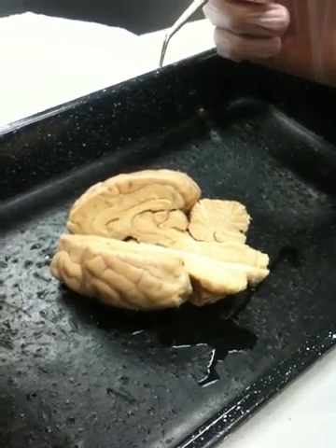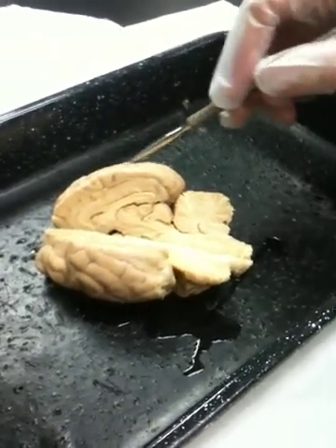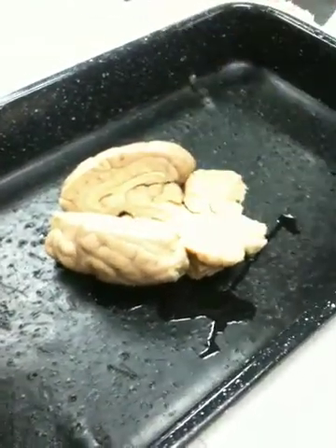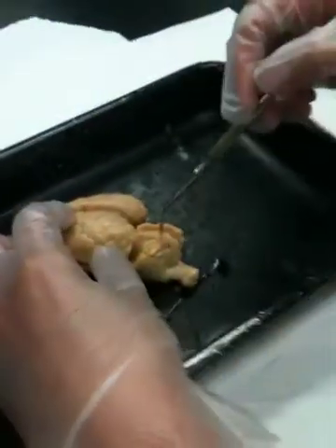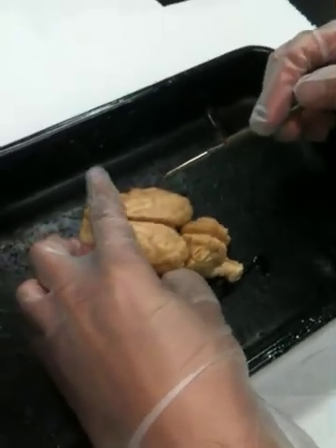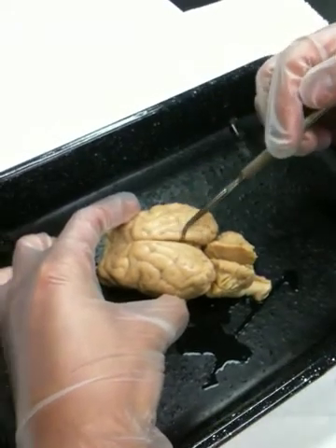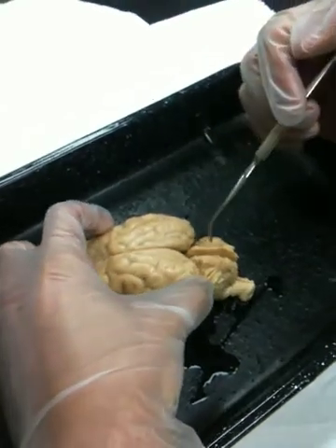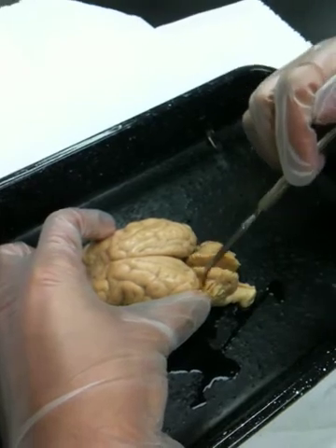Here at the upper surface, this convoluted, highly folded portion is called the cerebrum. Just behind the cerebrum, this other large structure is the cerebellum. The two portions of the cerebrum are divided by a groove. This deep groove is called the great longitudinal fissure between the two hemispheres of the cerebrum. We have another fissure which divides the cerebrum from the cerebellum. This indentation, this division line, would be the transverse fissure.